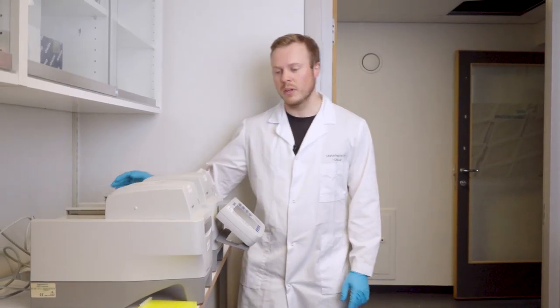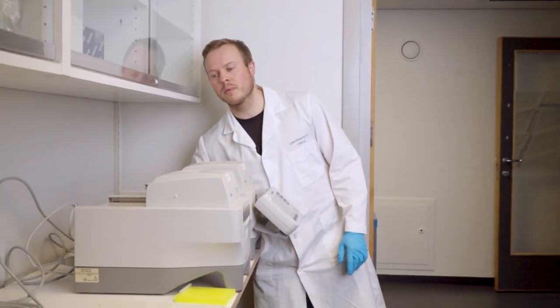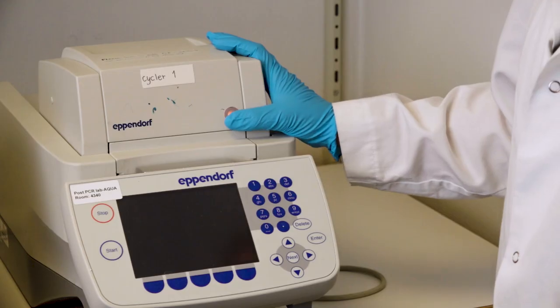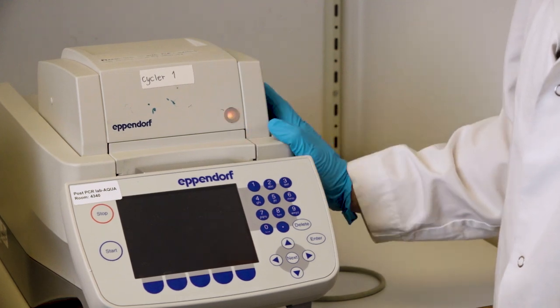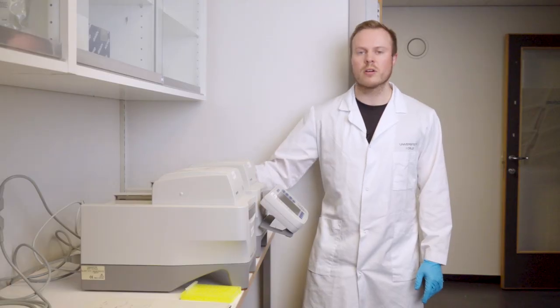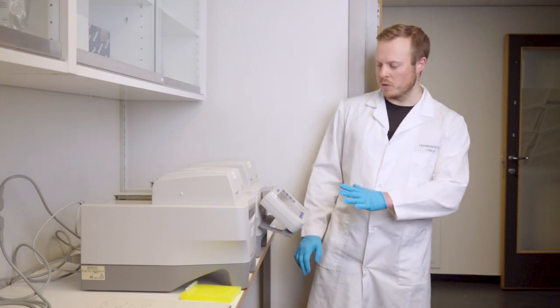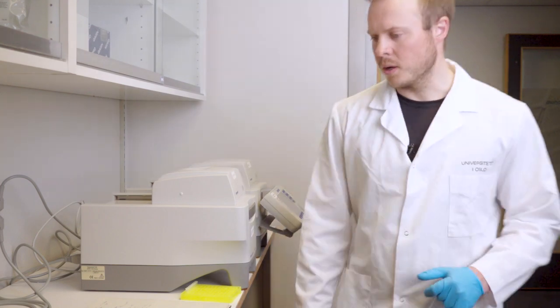Just a short recap: we turn on the machine, we get a color on the light here, and we hear that it starts up and makes some sounds.